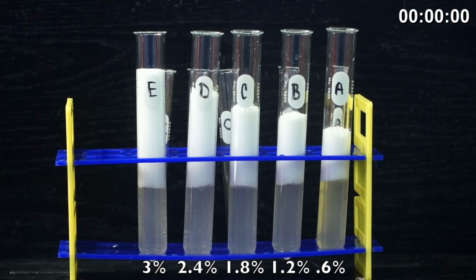All right, our 4 minutes is up. So in quick succession, as quickly as you can, we're going to go ahead and measure the height of the oxygen gas, or the oxygen foam, from the bottom of the foam to the top of the foam. If you do get a slant in the foam at the bottom, I would just measure from the middle point, just to keep that consistent in all 5 test tubes. So you'll measure from the bottom of the foam to the top of the foam and make sure you record that data in your data table.